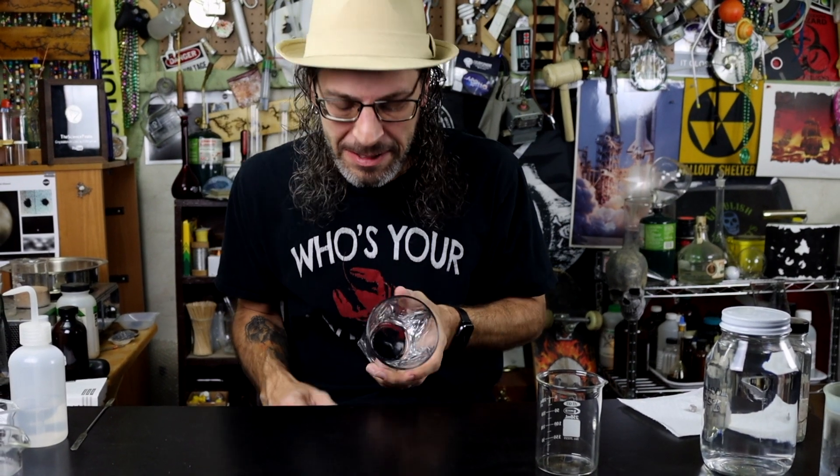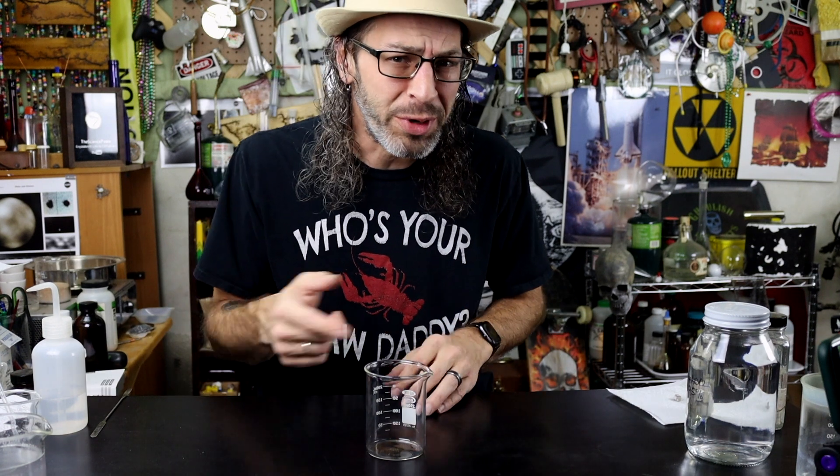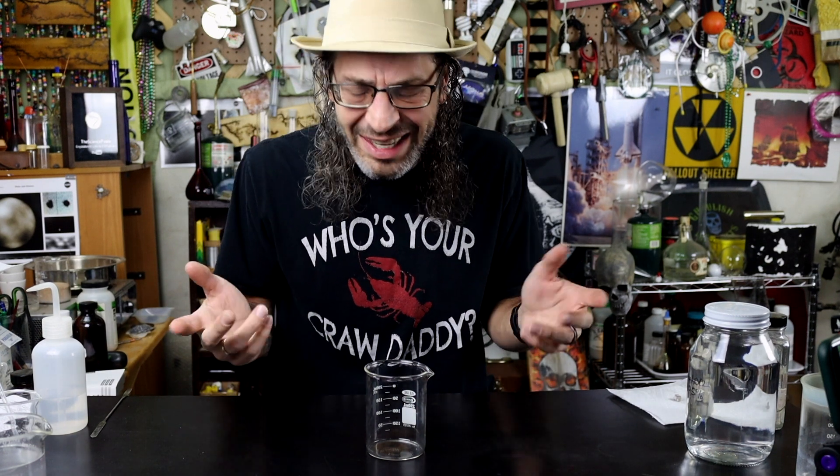That's where you put it, mate. You put it away. Now back to what we were talking about. You know, I've always wondered what would happen if you actually added some alcohol to the water before you put the sodium metal in there. So we've got to give that a try.